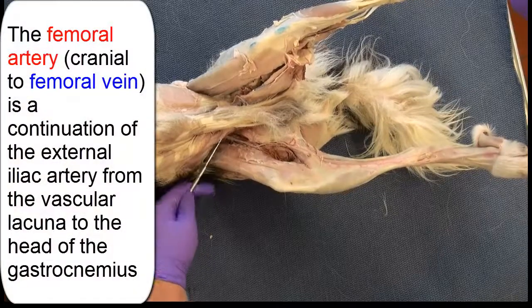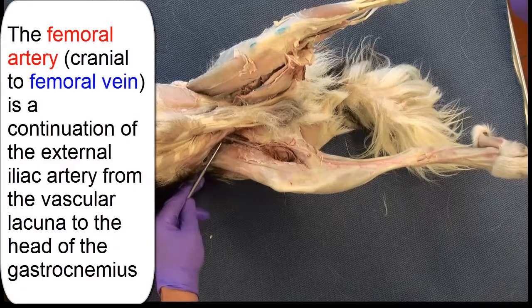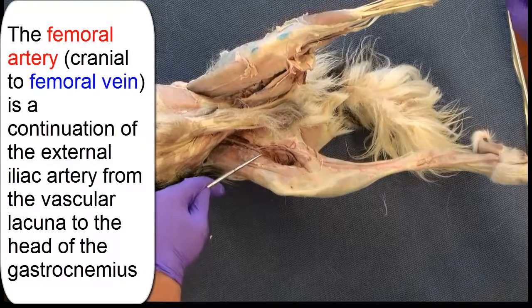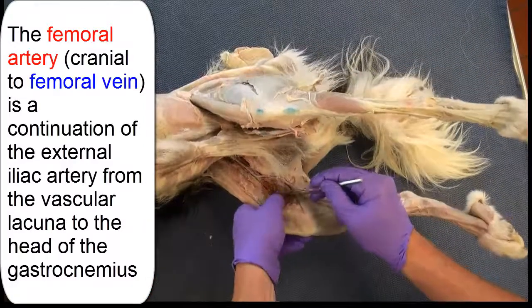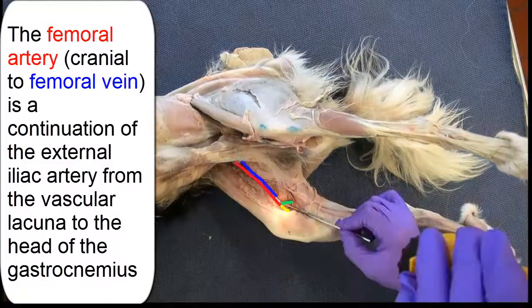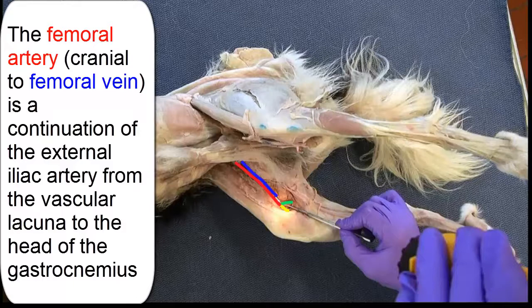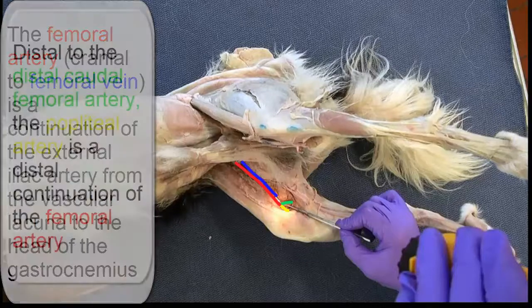The femoral artery, which is cranial to the femoral vein, is a continuation of the external iliac artery from the vascular lacuna to approximately the head of the gastrocnemius, just proximal to the stifle joint. You can see the probe running along the length of the femoral artery. In the next still image, the femoral artery is shaded red, and you can see its length and extent. It is cranial to the blue-shaded femoral vein, continuing from the vascular lacuna to the head of the gastrocnemius.